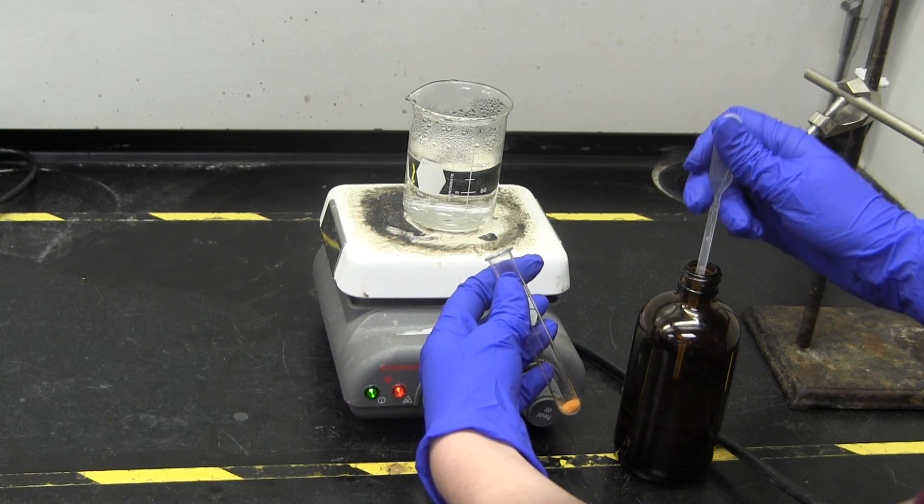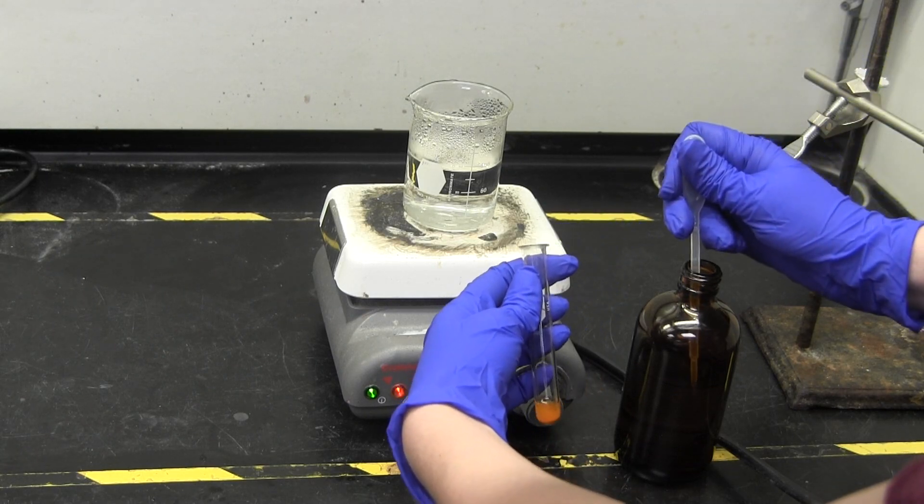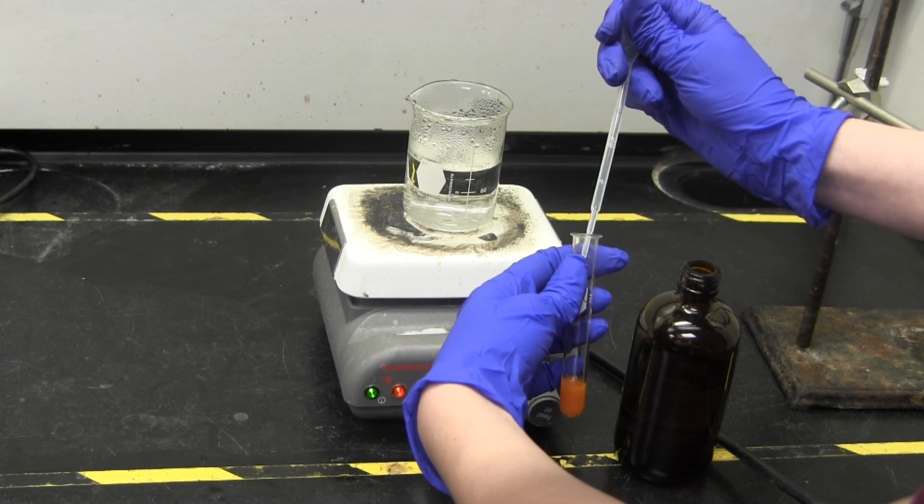To start, you will heat up water in a beaker to create a hot water bath. The water should be gently boiling to start the reaction.